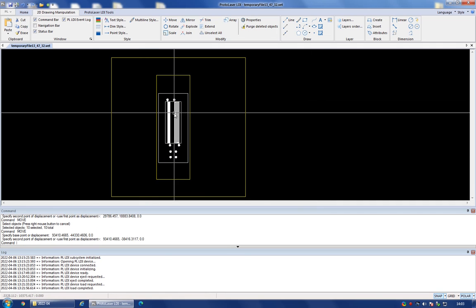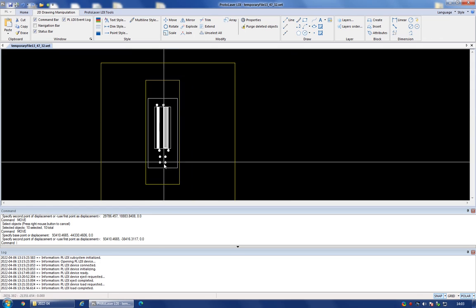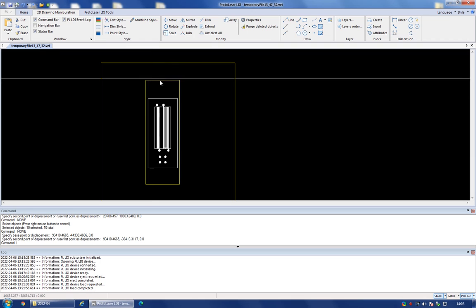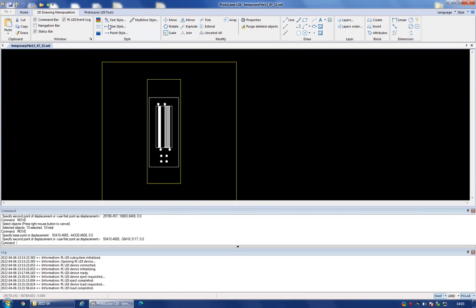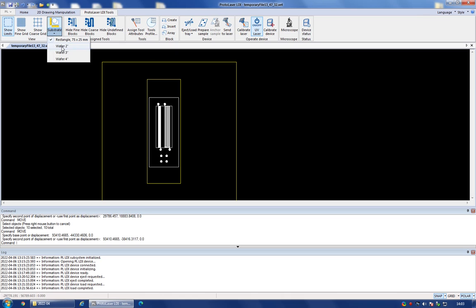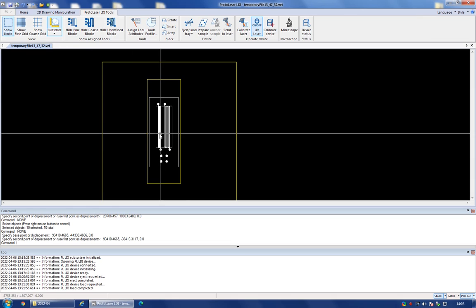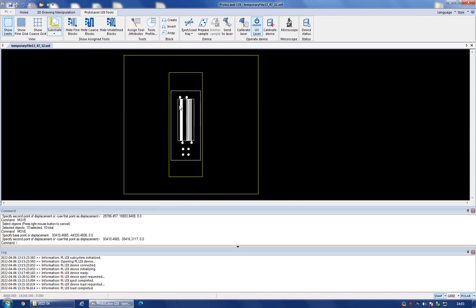So you want to make sure that all the blocks that you have defined are within the area of the sample that you're going to expose, which will usually be indicated by a yellow shade, like a yellow rectangle in this case. If you had different substrate, you could of course select all the different shapes for this. Okay, so now the structure is ready to expose.